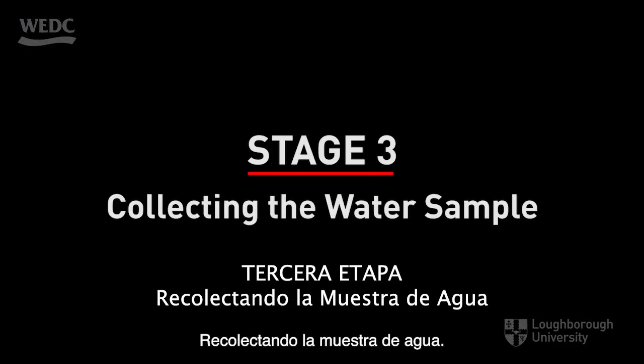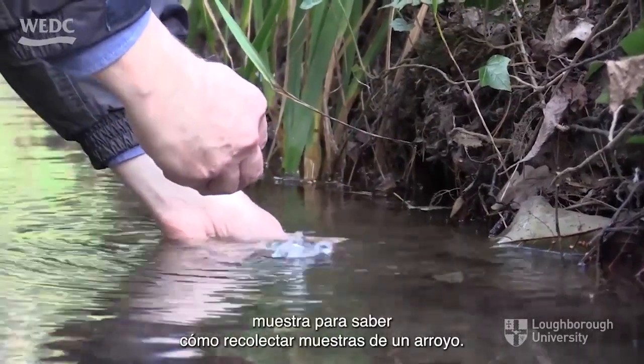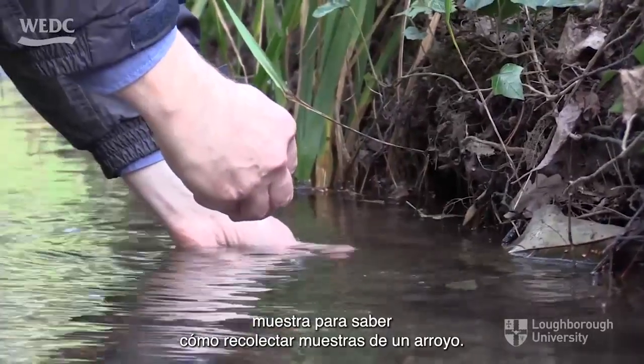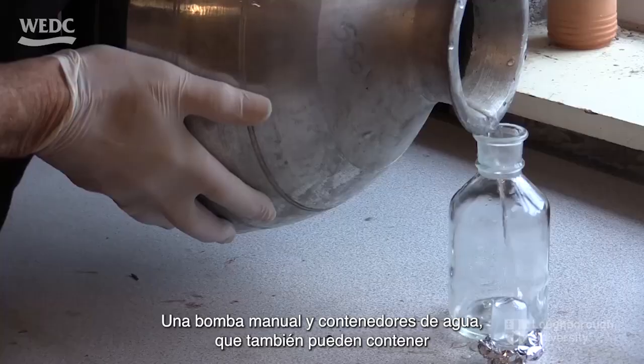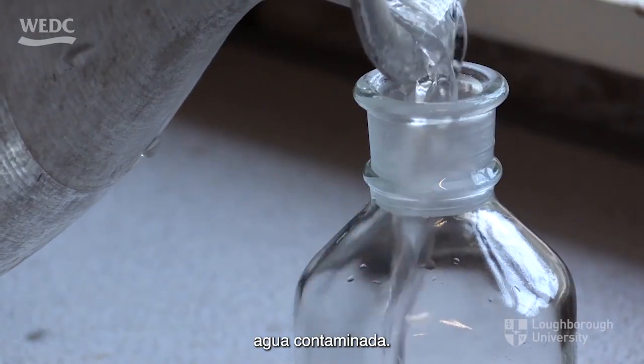Collecting the water sample. Refer to the separate film about water sampling to find out how best to collect samples from a stream, a hand pump and water containers, which may also hold contaminated water.